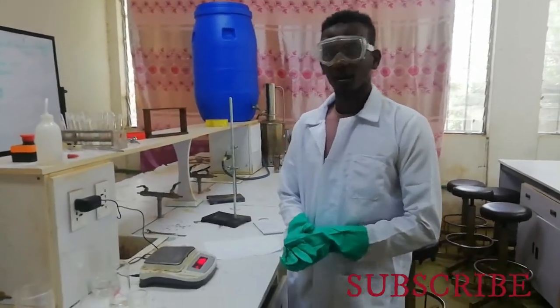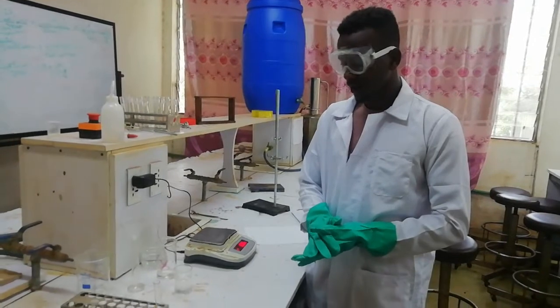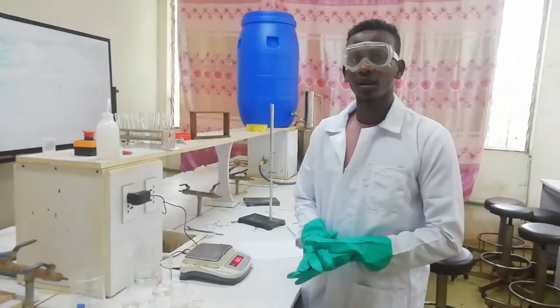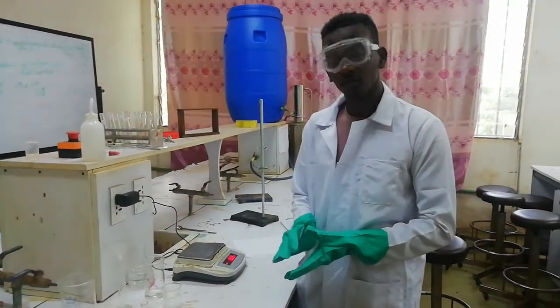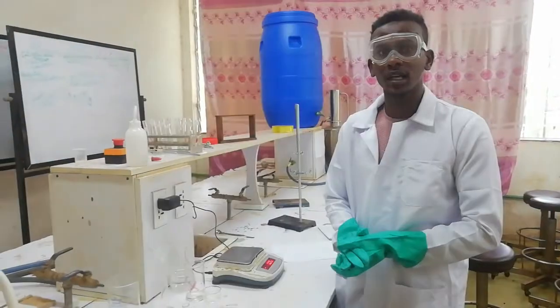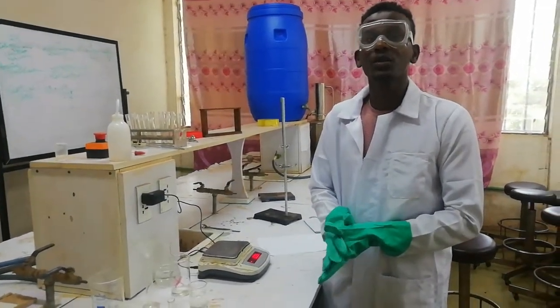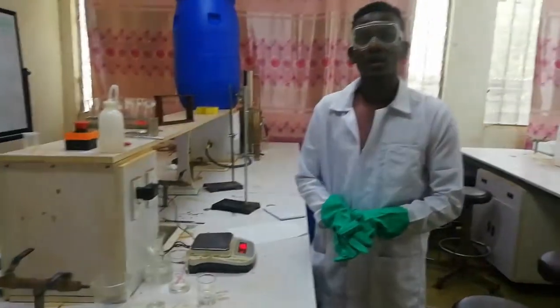Welcome to General Chemistry Laboratory. In the previous class we have seen about mass and volume measurement. Today we are going to see the second part of General Chemistry lab, which is identifying substances by using physical properties — in terms of boiling point, in terms of solubility, and in terms of density — calculation of density of your unknown substance.